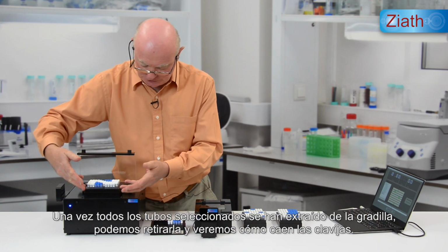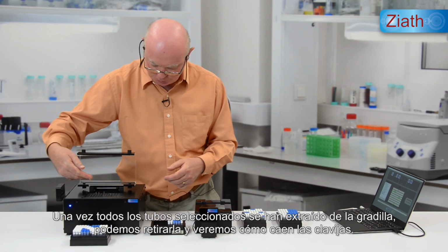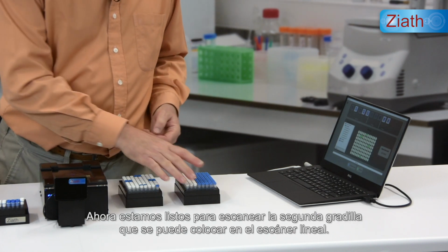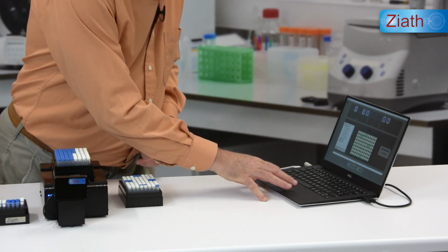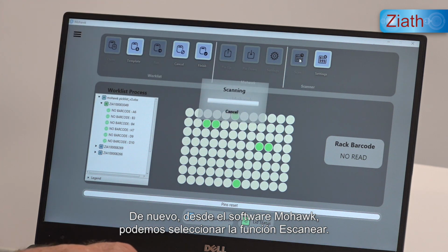Once all of the picked tubes have been taken from the rack, that rack can be removed and the pins will drop. We're now ready to scan the second rack, which can be placed onto the linear scanner. Again, from within the Mohawk software, we can key the scan function.